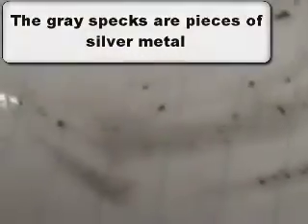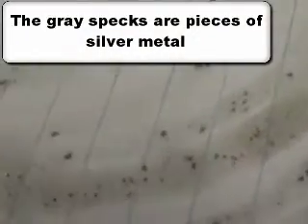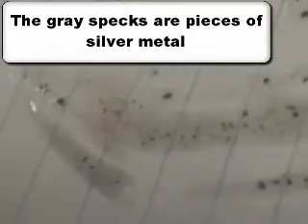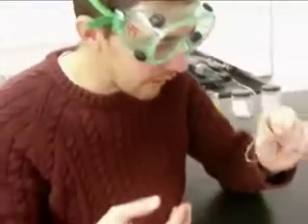Chunks of silver. So if we were to collect that silver, Mr. Sams, we could make a ring out of it. We could, or take it down to your local pawn shop and make some money. Yeah, there you go. In this economy. There you go. But it's why silver nitrate's so expensive, because it has actual silver in it. There you have it. Single replacement.